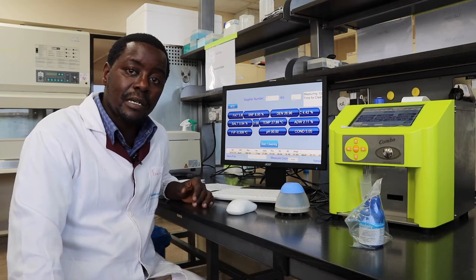Welcome to this instructional video. This time round I'll take you through the LactoScan MCC Combo milk analyzer cleaning procedure.